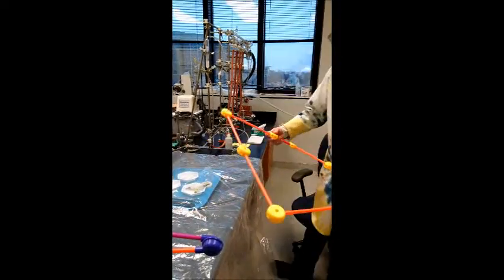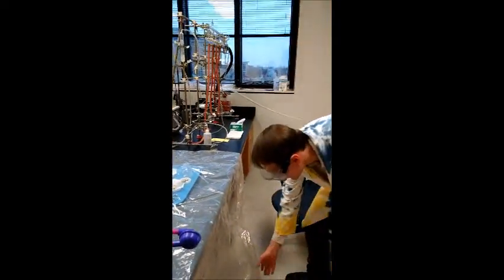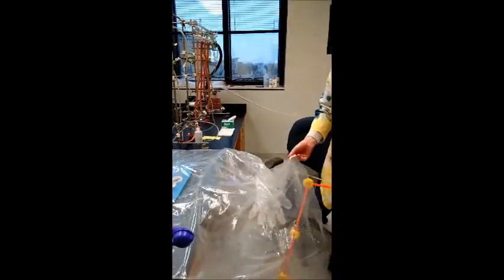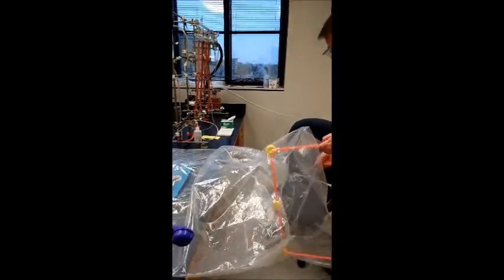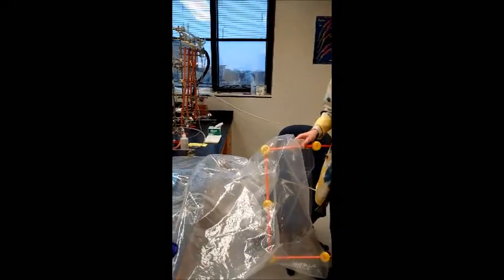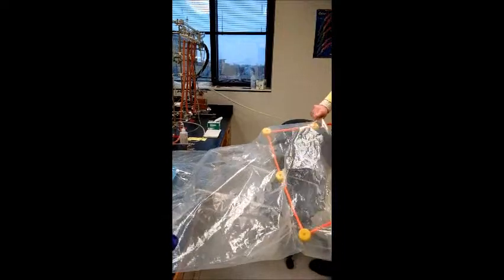First we're going to put everything we need in the glove bag, including a frame to hold up the glove bag to make it easier for us to manipulate the gloves.